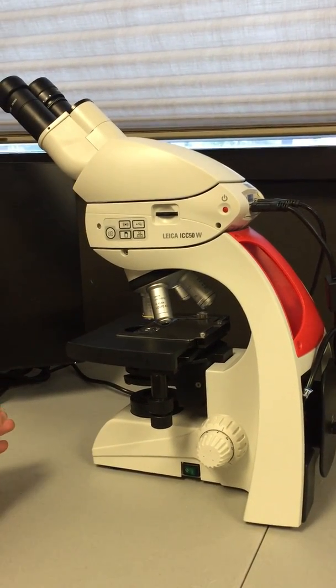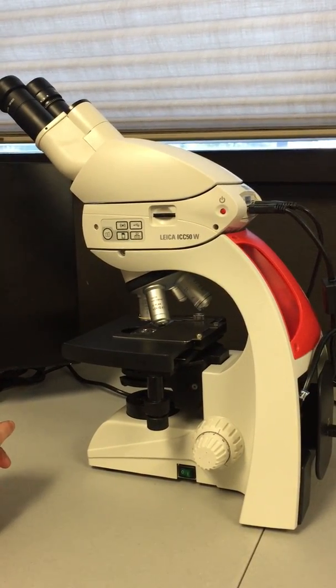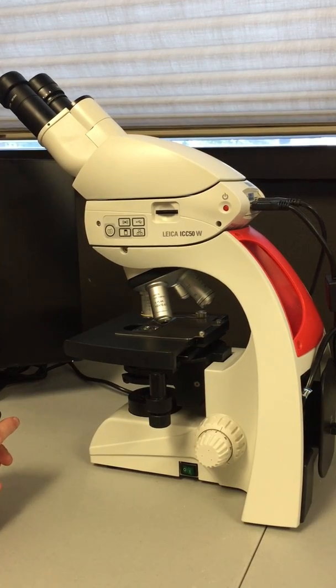Now that you set up your Leica DM750 and Leica ICC50W camera, I'm going to show you how to operate them.